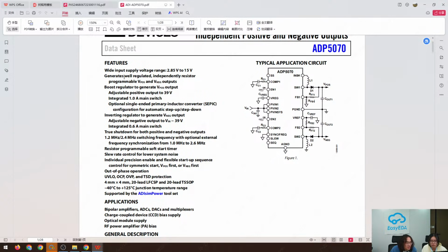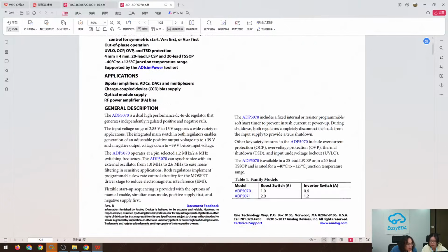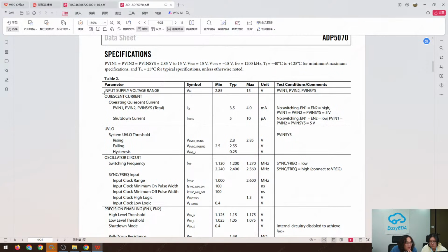And we can see some detailed information here. The input range of the chip is 2.85 volts to 15 volts. And the output, it's adjustable. So, and we can scroll down to the specifications. We can see the input voltage range here.